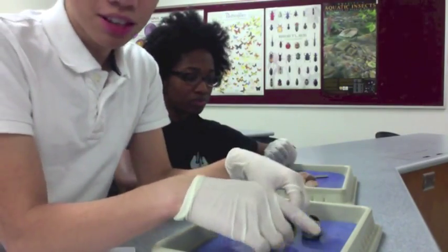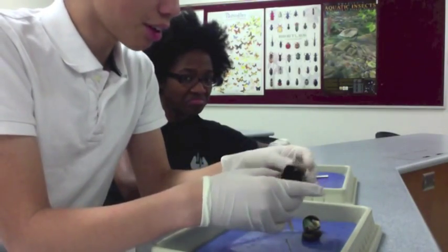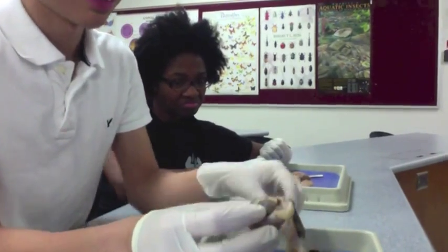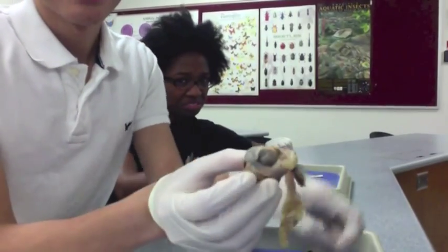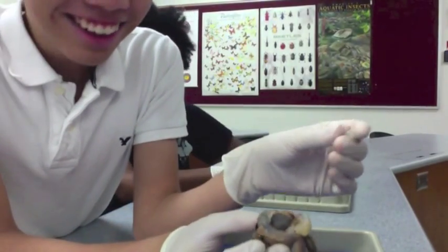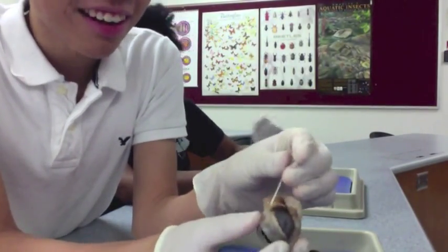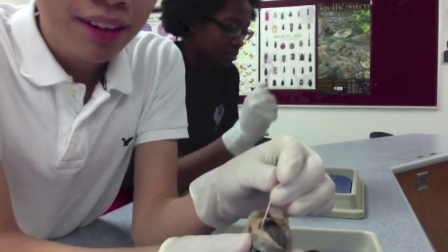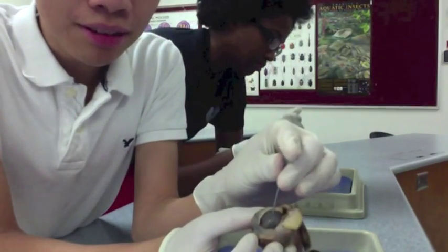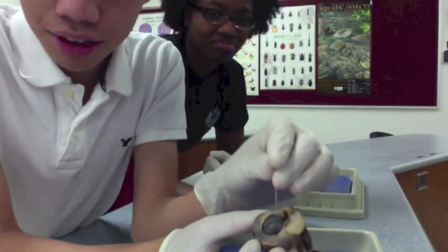Now we're going to go on to the sheep eye. So we have, of course, the sclera, which is the white part of the eye. Then we have the cornea, which is this little thing right here. That's your cornea.